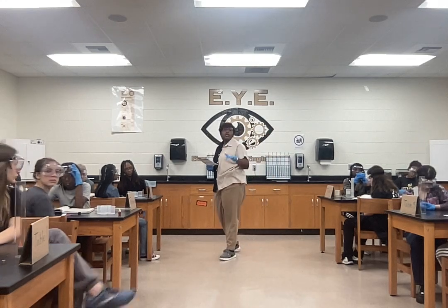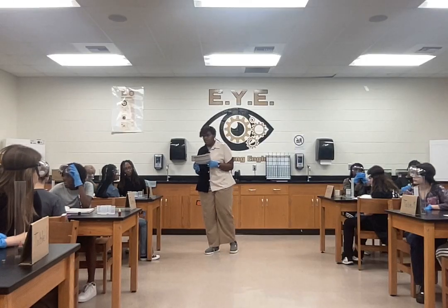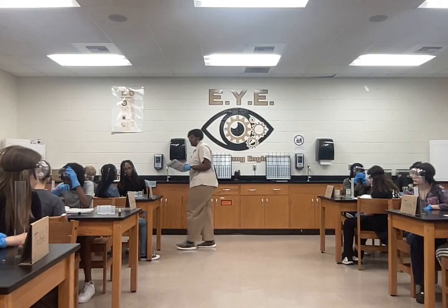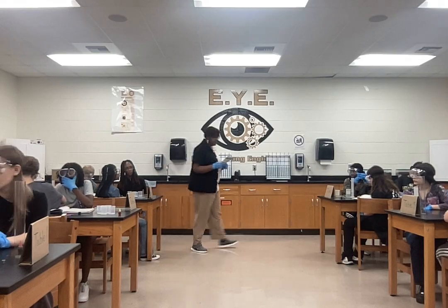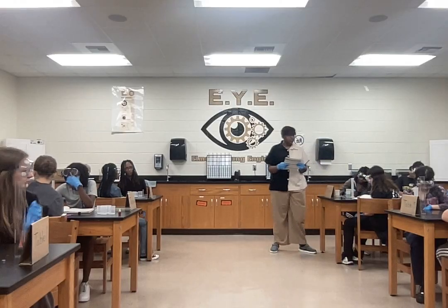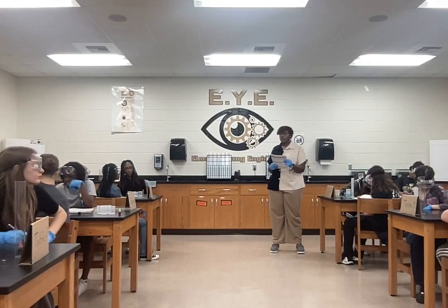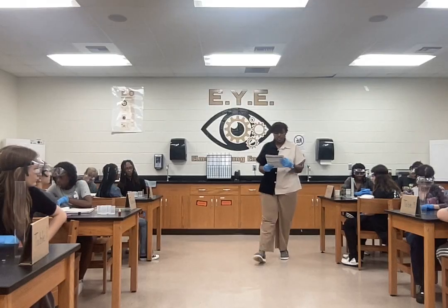So for the water itself, we get 39.58. And what is our volume of water again? How much water did we measure out? Yes, 25 milliliters. Good.